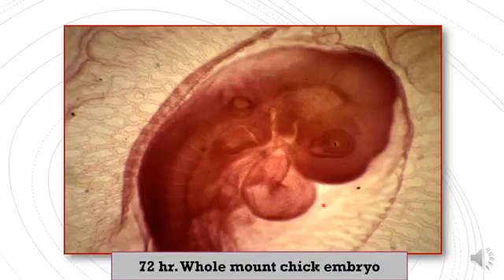And the next slide, 72 hours, also a whole mount of the chick embryo. This slide shows more development of the heart tube.